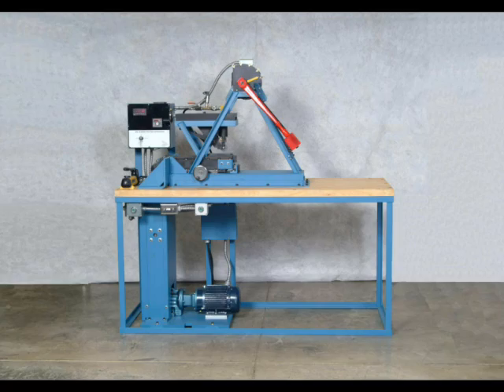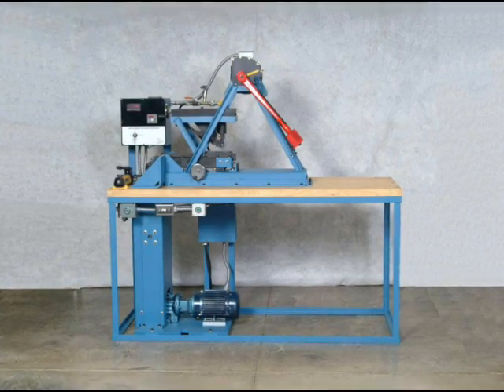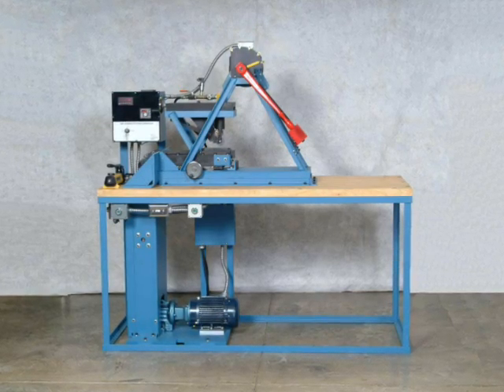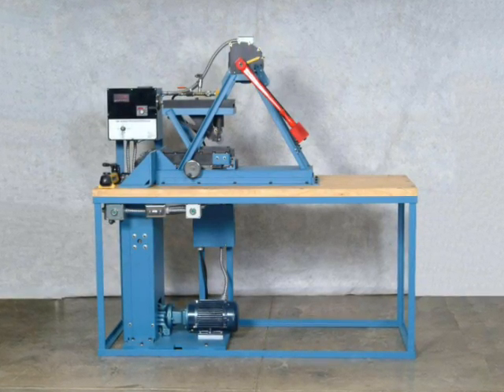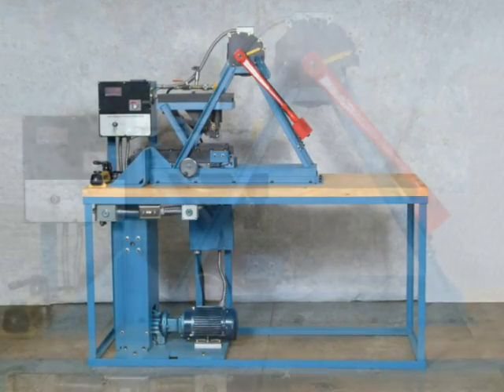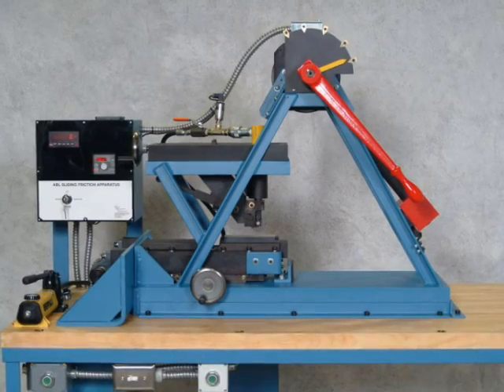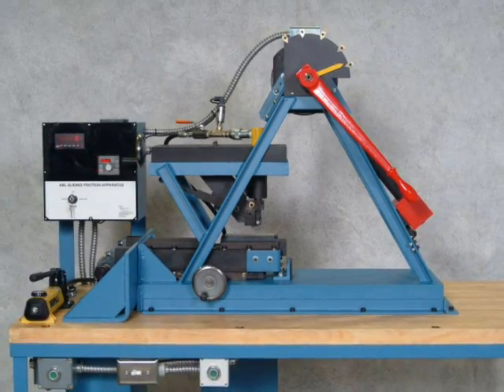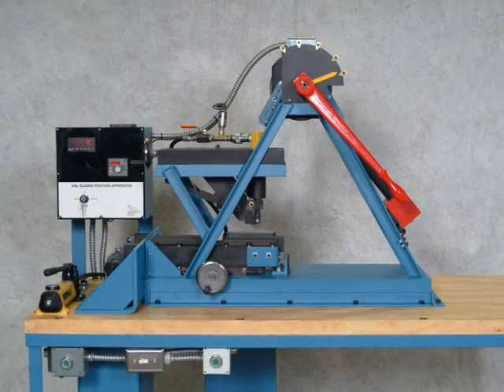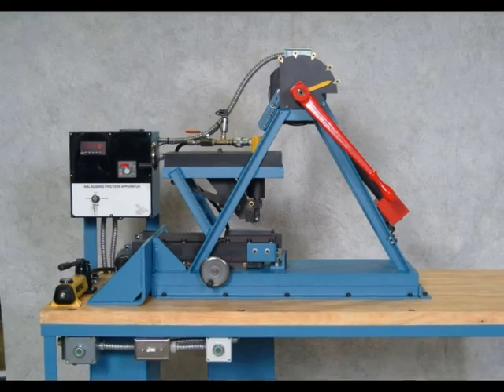The ABL friction test machine is capable of delivering a sliding frictional force into a sample of test material. The unit is composed of two separately functioning mechanisms: the swing pendulum arm and the chain pull driver. The machine measures the amount of energy required to cause a reaction. This data can be used to evaluate the sensitivity of the material to friction and to determine critical safety parameters related to the manufacturing and handling of the materials tested.